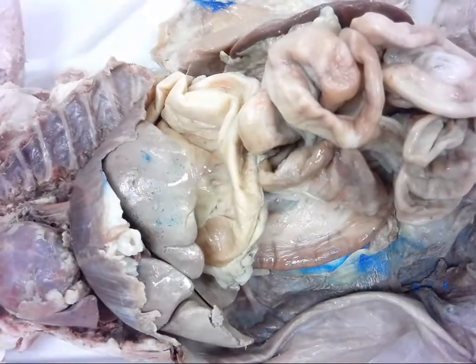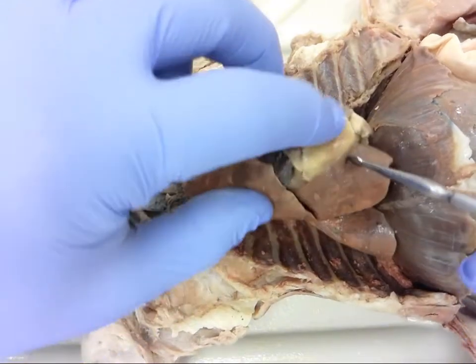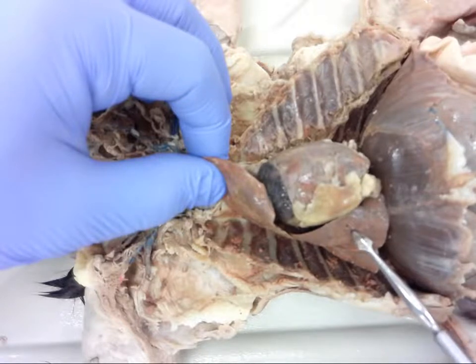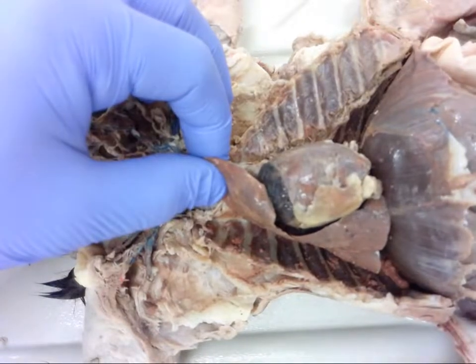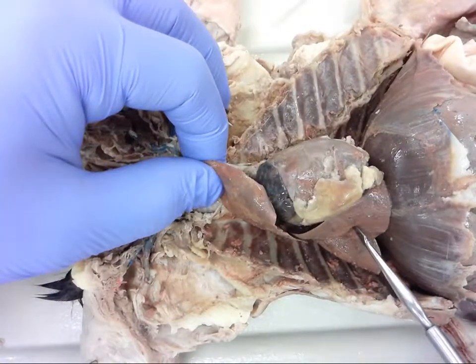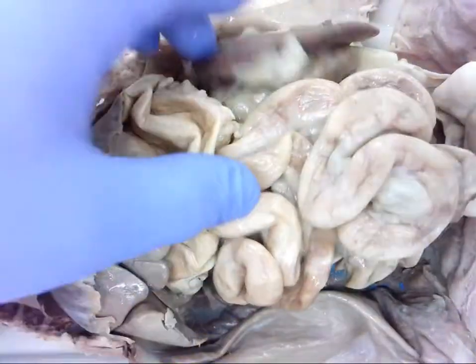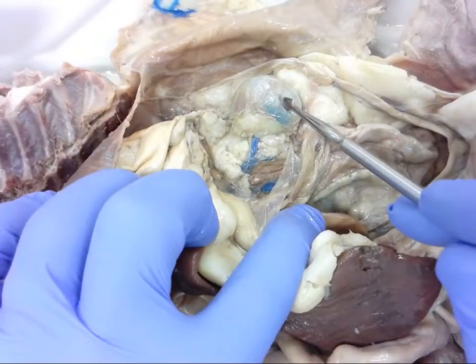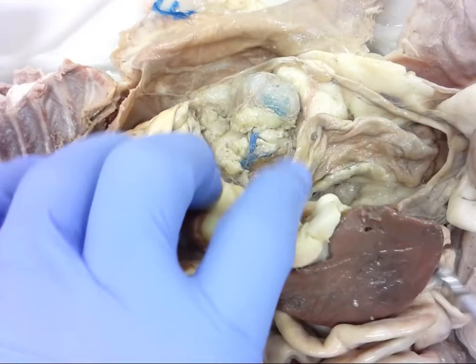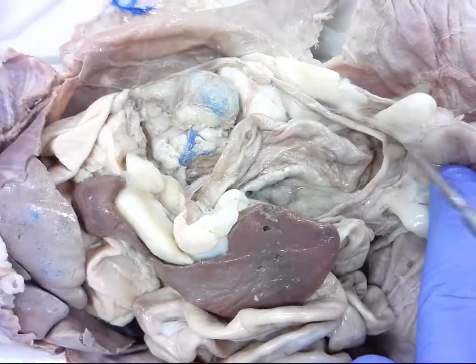Number seven — it's been partially removed but still visible on this side. This is number seven. Number eight — I have to move some things out of the way to get to number eight. Number nine — got a decent view here. This is number nine.